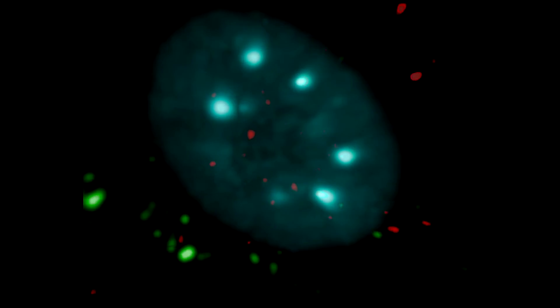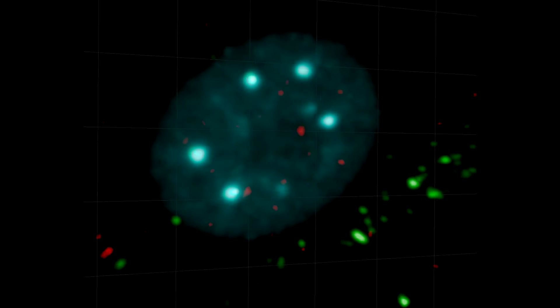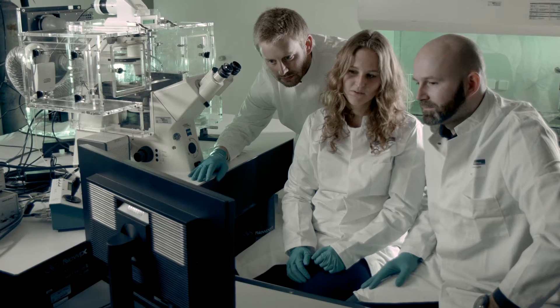By labeling different viral components with different fluorescent markers, we can directly observe changes in the subviral complexes.